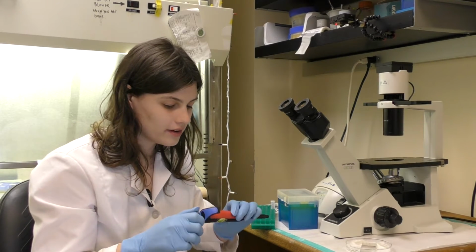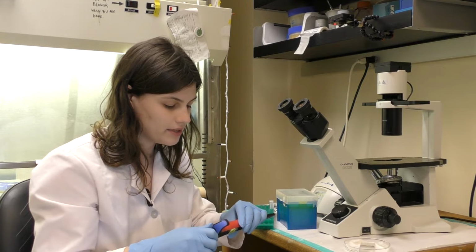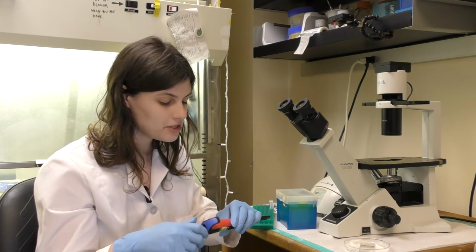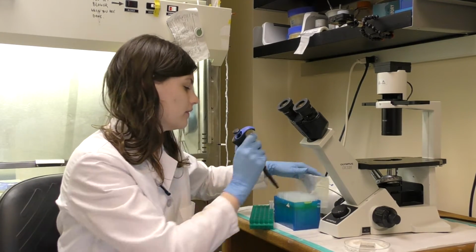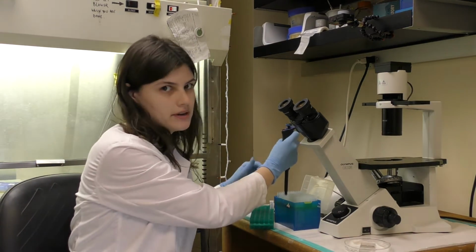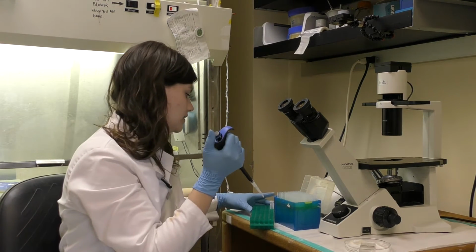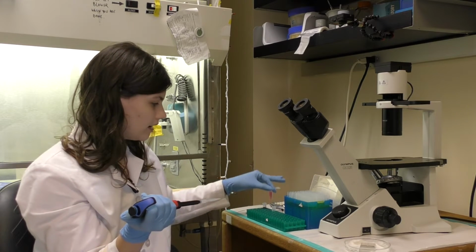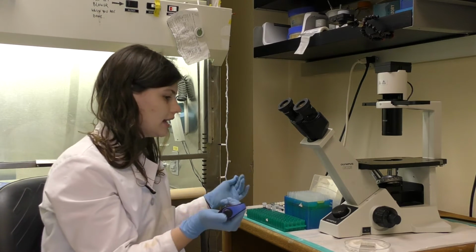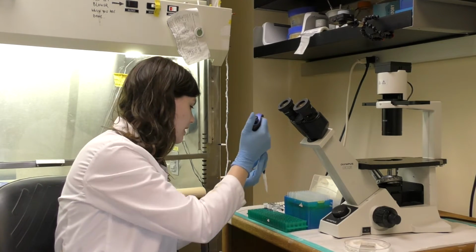Hey guys, so now we're going to count our cells that we took from the original 5 ml suspension. So we spun down, and then we put 5 mLs of fresh media after we aspirated out the old media and trypsin solution. And so now I've collected a little bit of that solution outside of the hood, and this is going to be a terminal assay, so it's okay that it's not in sterile conditions now.